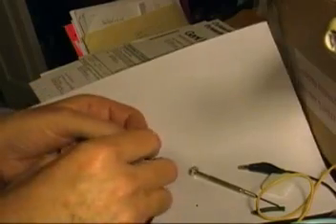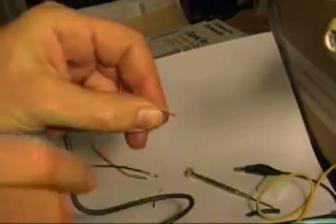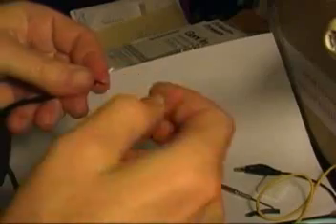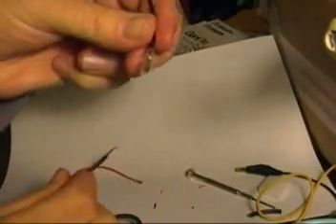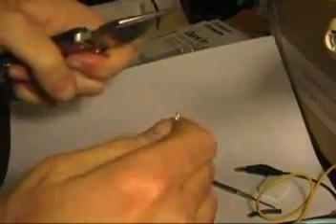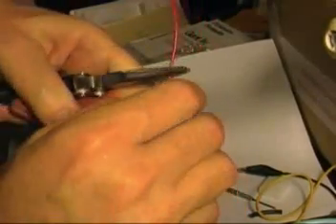Here I'm doing the stripping with my thumbnail. Next I'm going to remove the existing wires from these pins that I'm going to reuse. These are the female side. First I tried to do it by hand and then decided pliers would be better. Once I get the pliers on it and give it a good yank and jiggle, it comes off. These are going to be reused shortly.